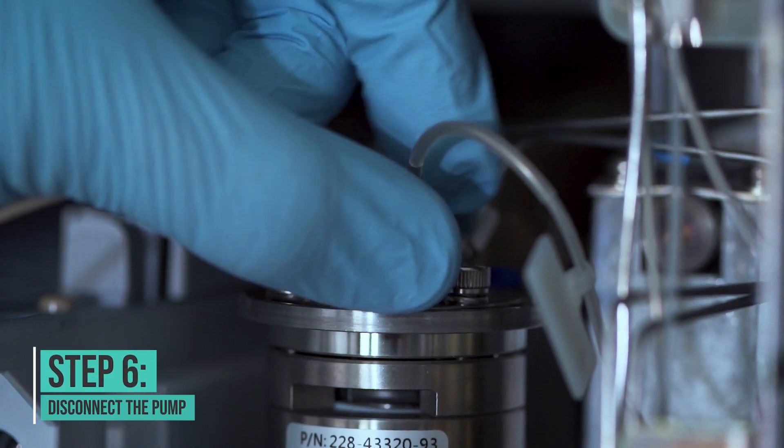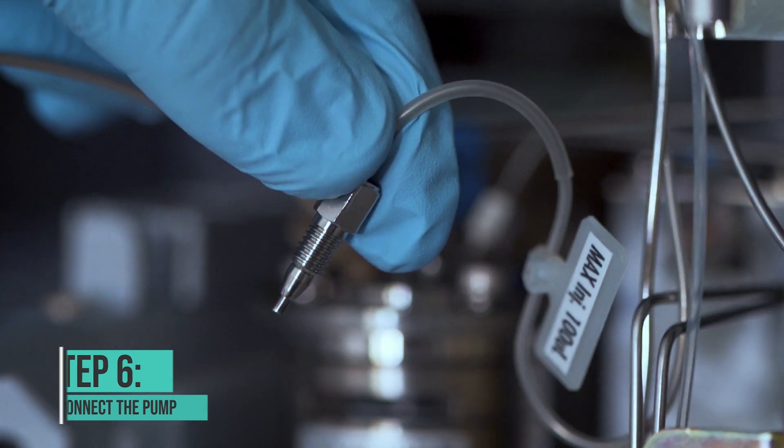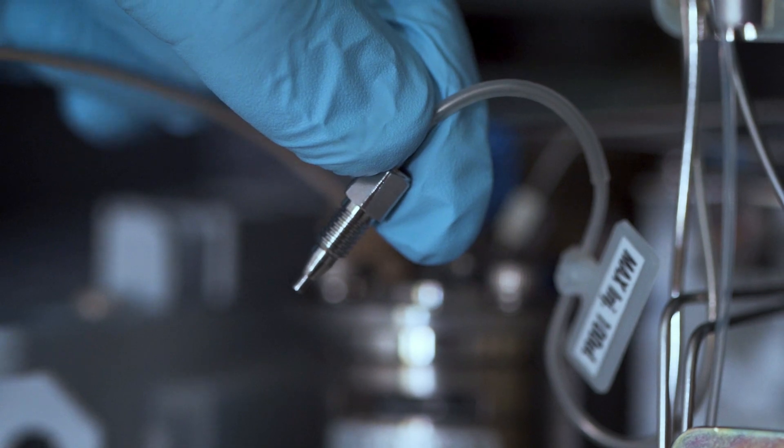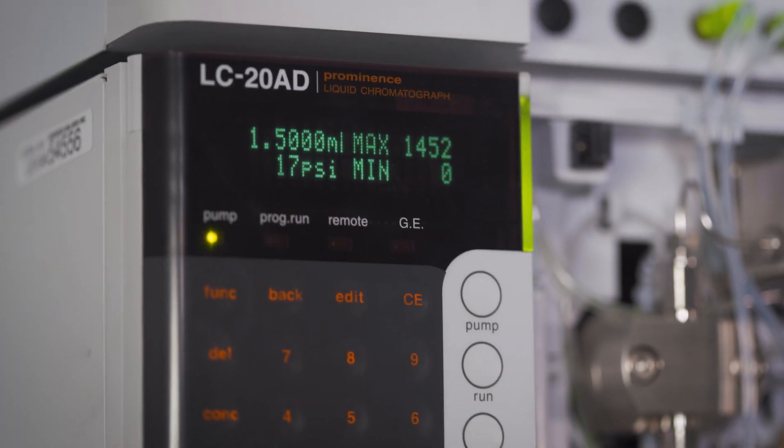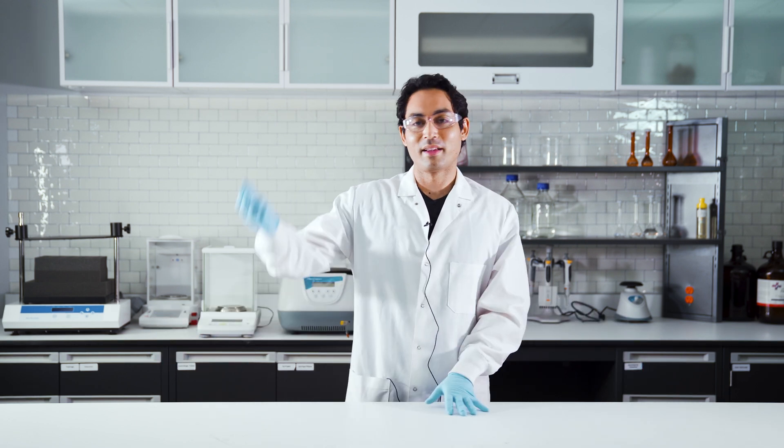If it's not the needle, then it's going to be the lines from the pumps to the mixer and the mixer back to the six port valve. Disconnect those and see if the pressure goes down. Most likely you would have already gotten the clog by then, but now you're going all the way back up to the pump. Most likely you would have found your clog by then.